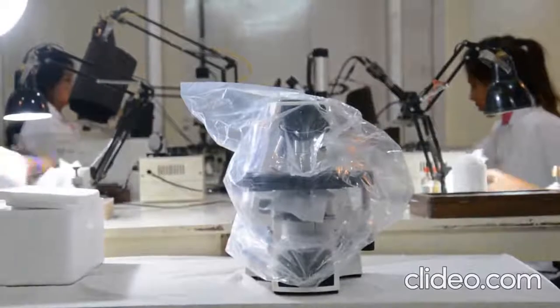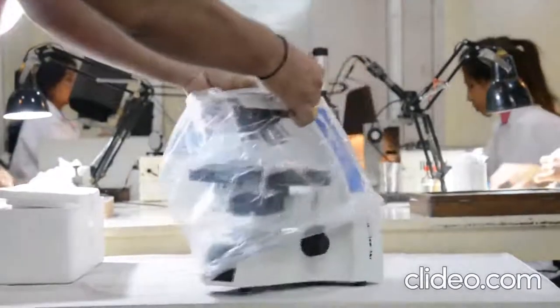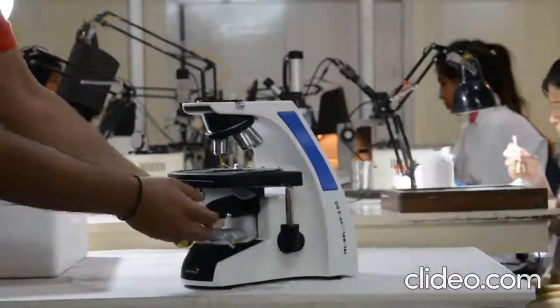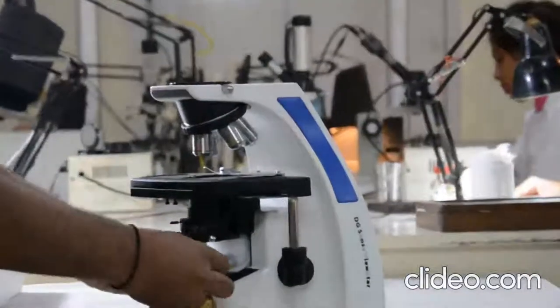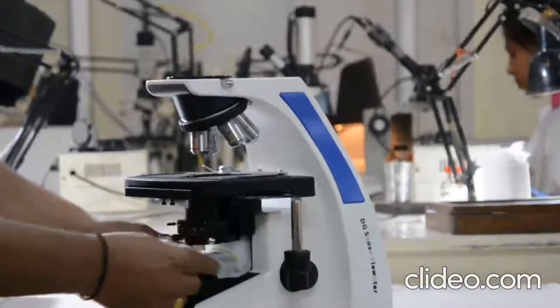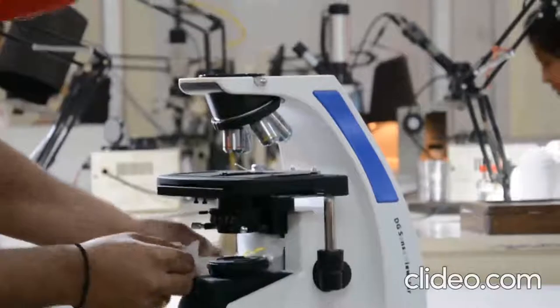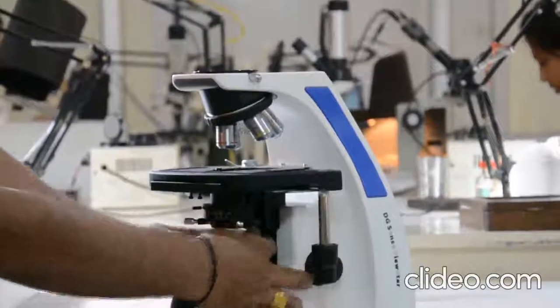Now we will take out the sheet cover of the microscope.